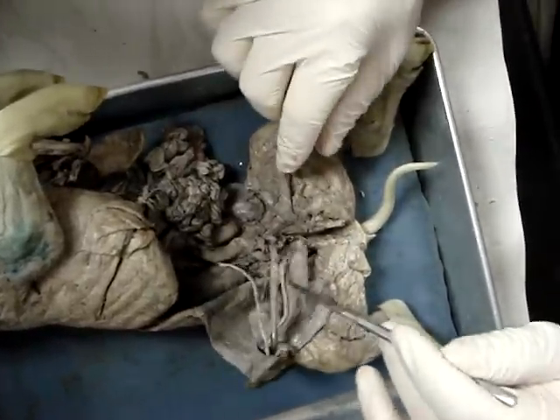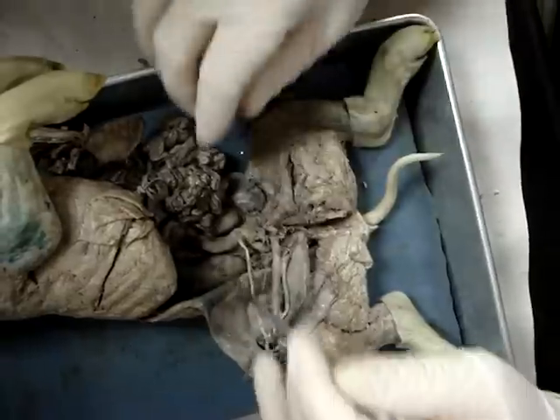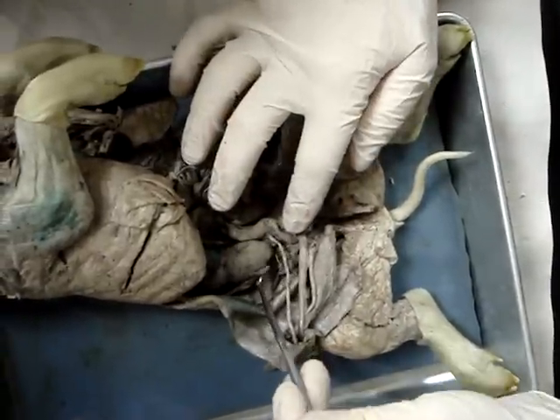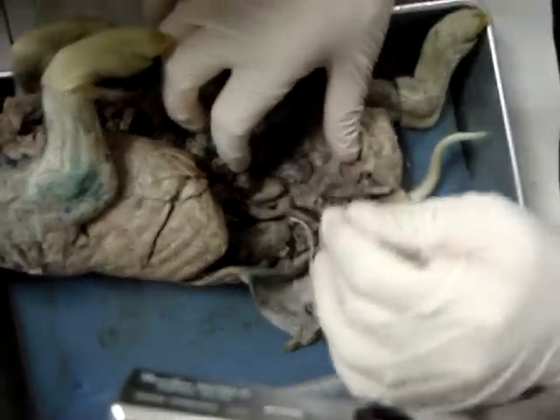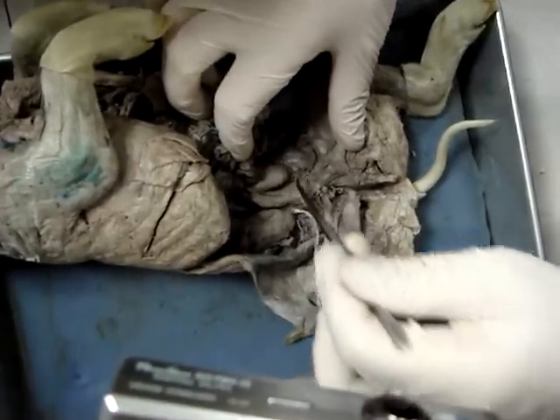Here we have the urinary bladder. The urinary bladder connects to the kidneys by way of the ureter, and these ureters are smushed. Here's one — here's the ureter.